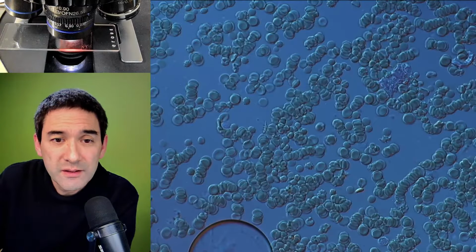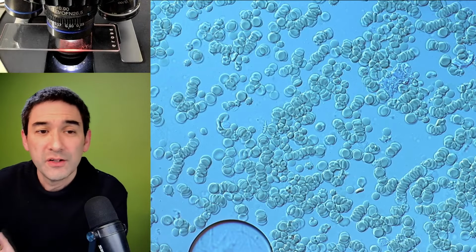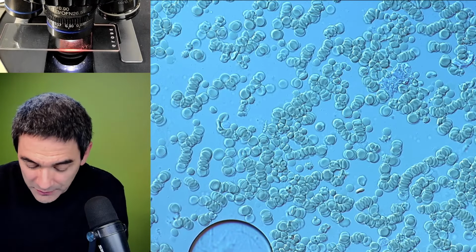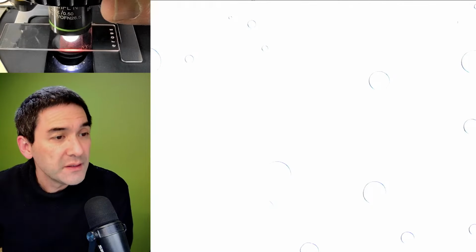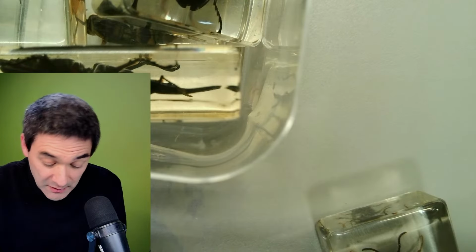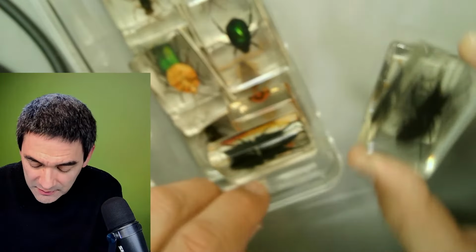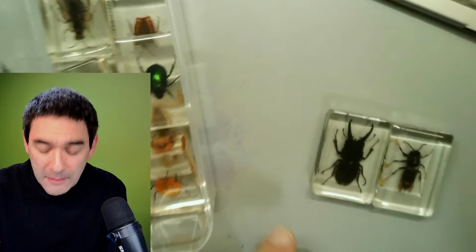Let's move it like this. Maybe let's remove the color a little bit here. Okay, you get the idea. But I digress, because today's topic should be a little bit more about those insects. I want to show you now some more of these insects that are all commercially made.